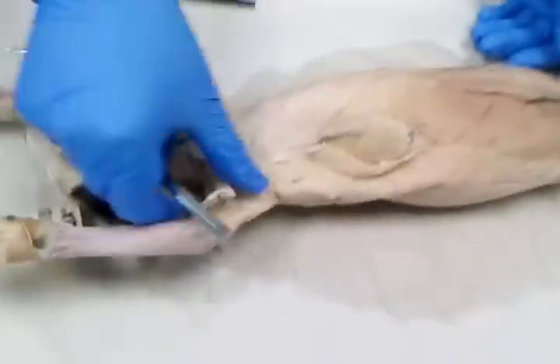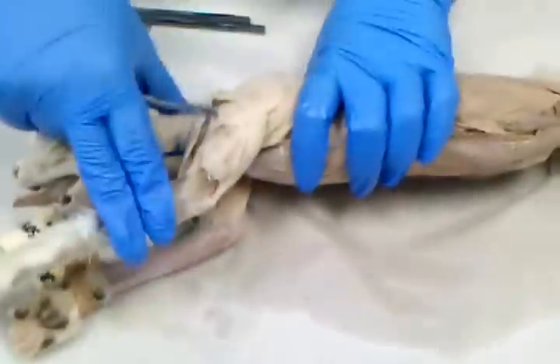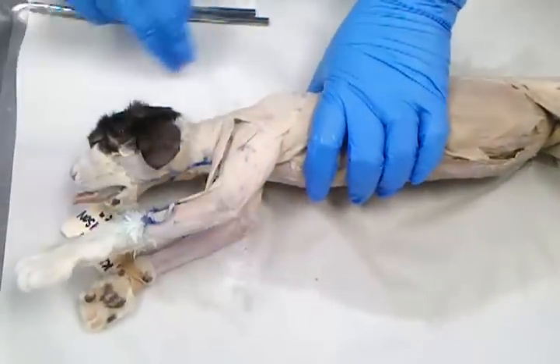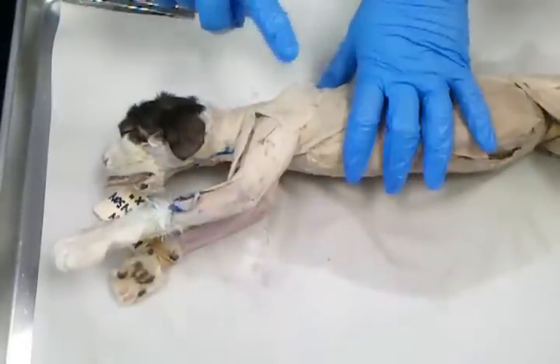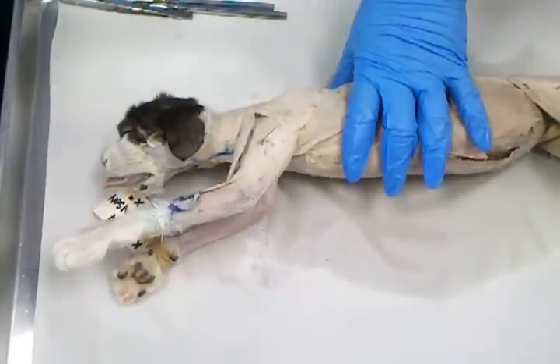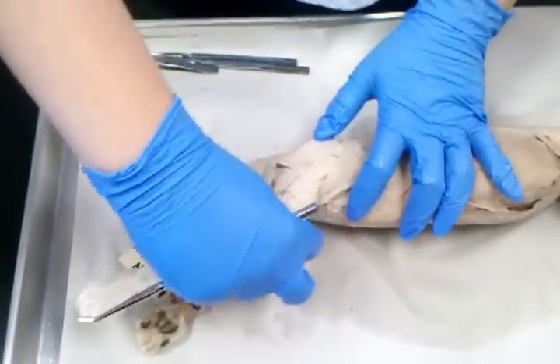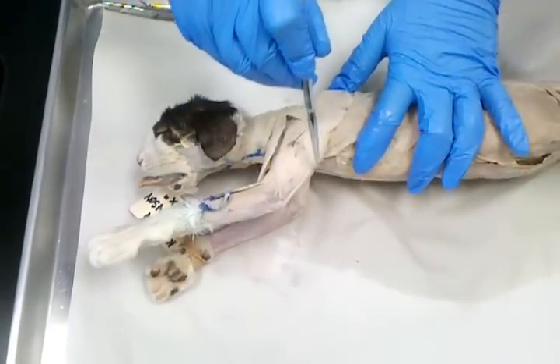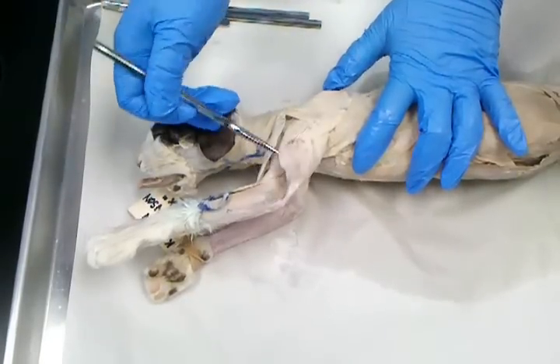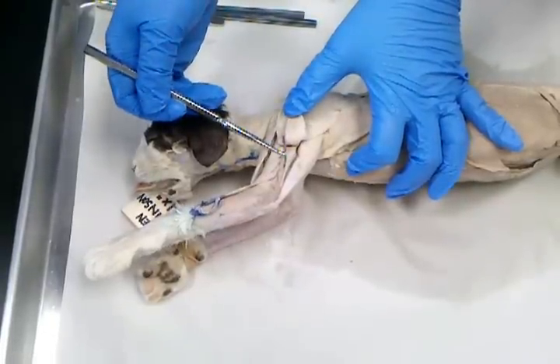Okay? Now I'm going to walk you through the forelimb muscles, or the arm muscles. Okay? All right. So on the outside of the arm, you've got the triceps brachii, and it has 3 heads. So if I ask you this on the lab practical, you have to tell me, you know, it's the lateral head of triceps brachii. I need all of it. Okay? So the lateral head is this middle piece right here. Okay? Long head is on the bottom edge of the arm. And if I flip back the lateral head, deep to the lateral head is the medial head.